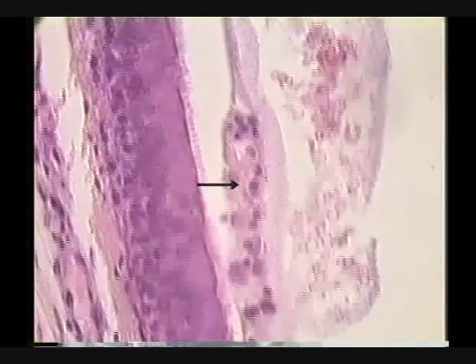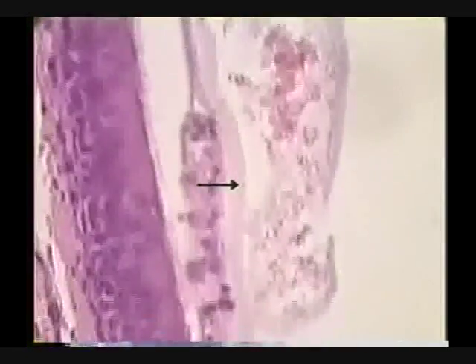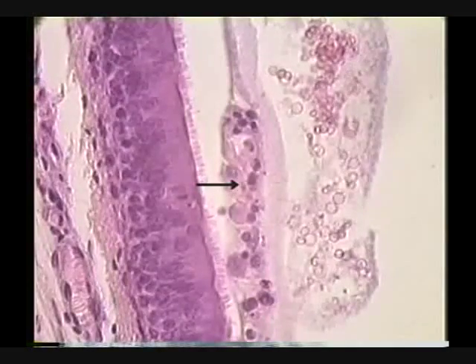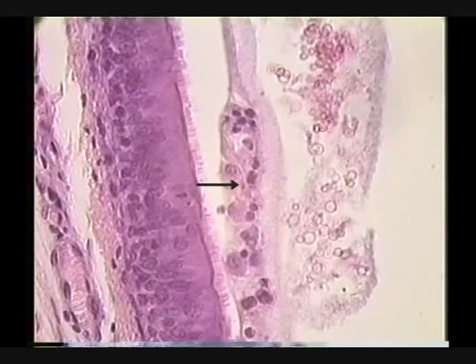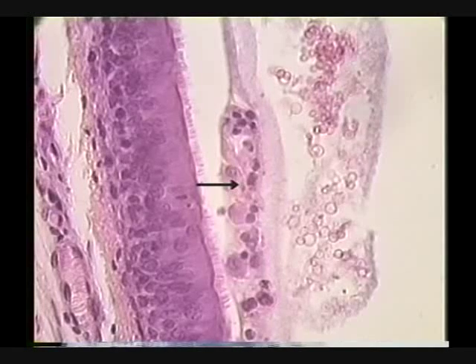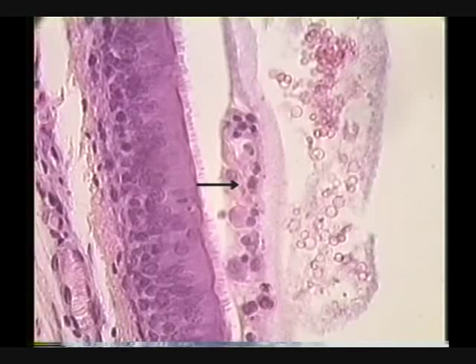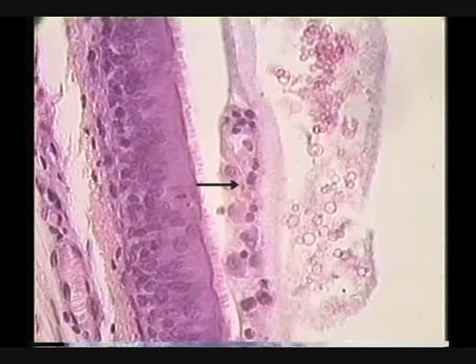White cells, mucus. That even looks like some red cells there. This must have bled in there when they did the section. But white cells, mucus, the debris. That's snot.